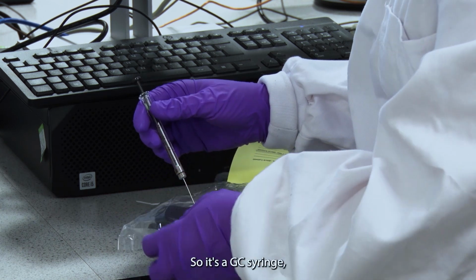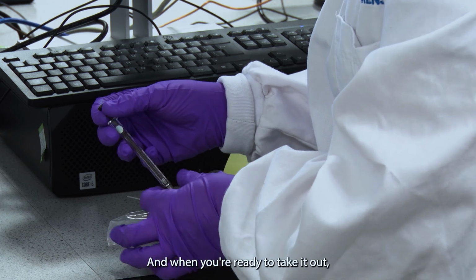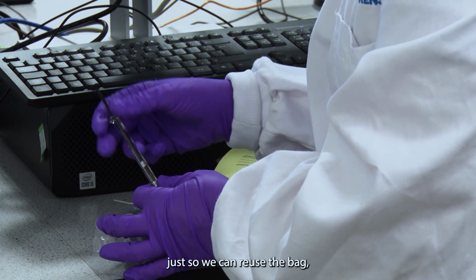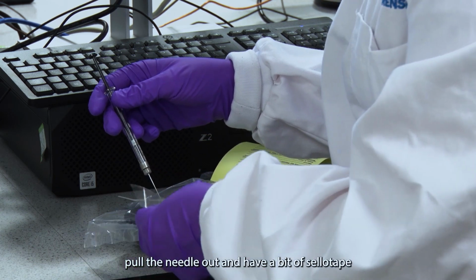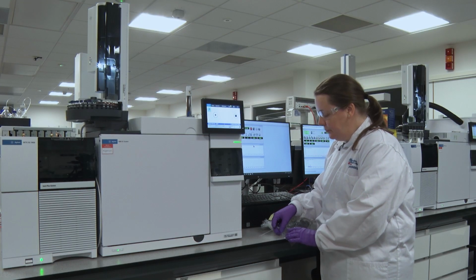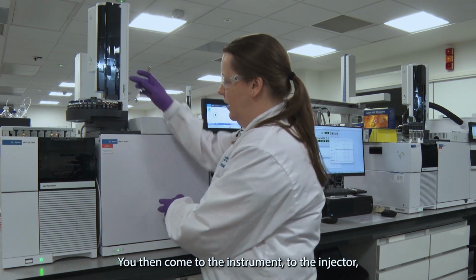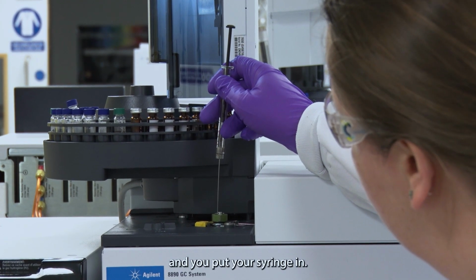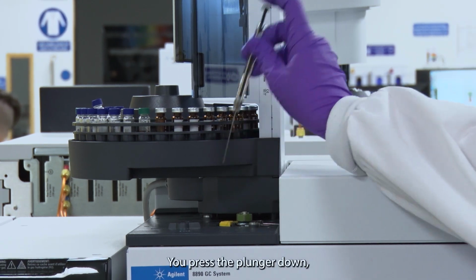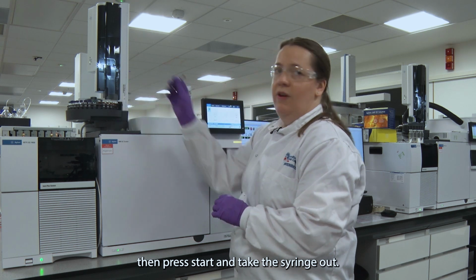It's a GC syringe, so it's a little bit stiff. Just point it up, and when you're ready to take it out, just so we can reuse the bag, pull the needle out and have a bit of sellotape ready to cover up where you injected it. You then come to the instrument, to the injector, you put your syringe in, you press the plunger down, press start and take the syringe out.